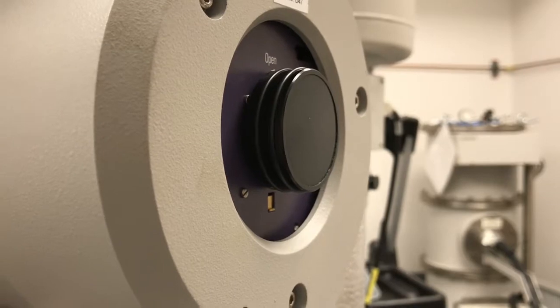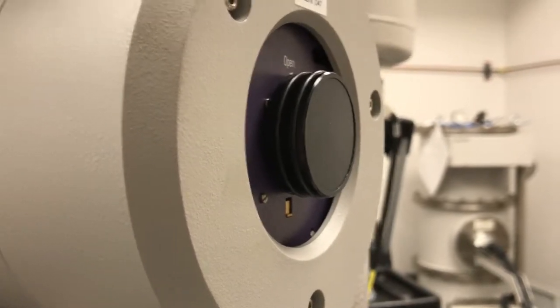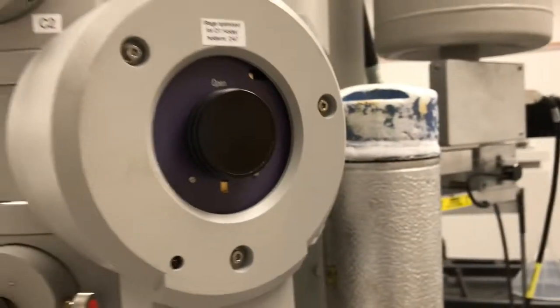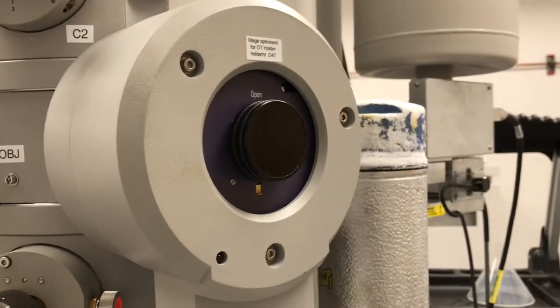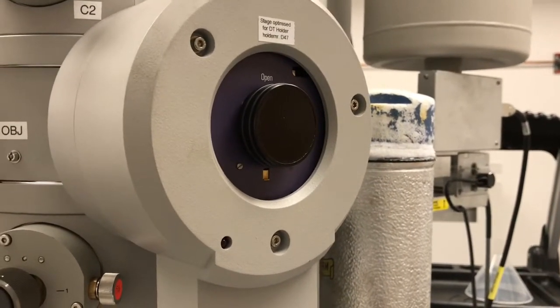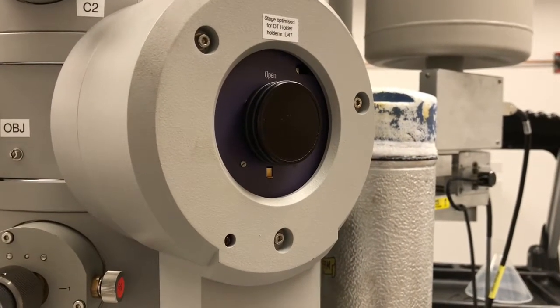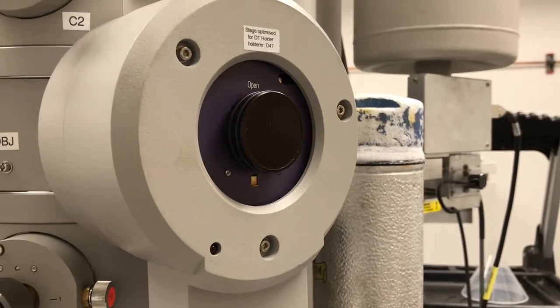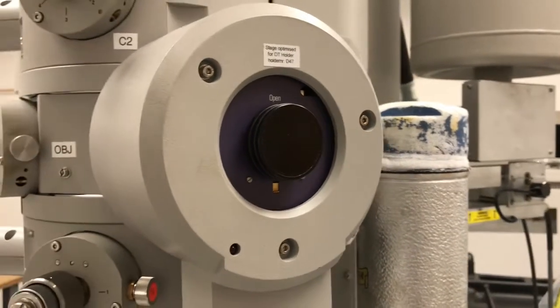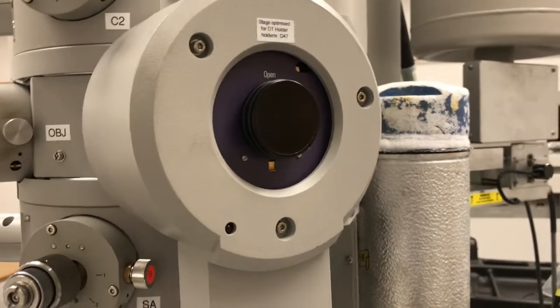Where people usually have problems with insertion again is just lining up that pin. If you get that done properly, usually there's no subsequent issues. We'll go ahead here, we'll just demonstrate all these parts again one more time.